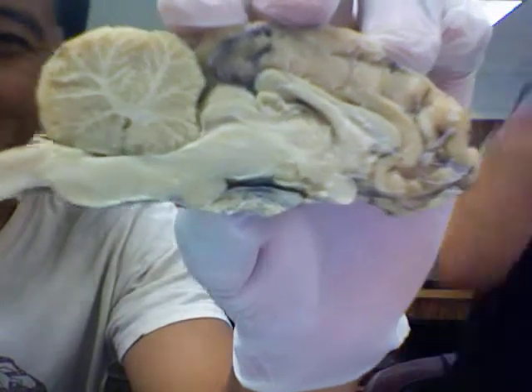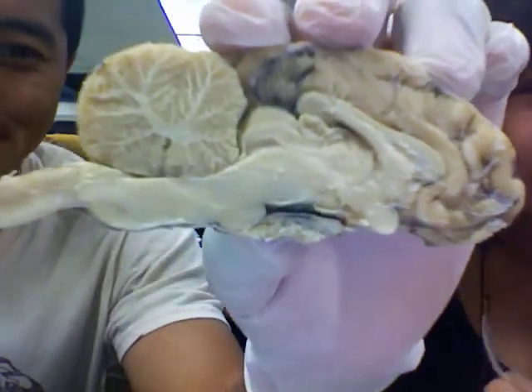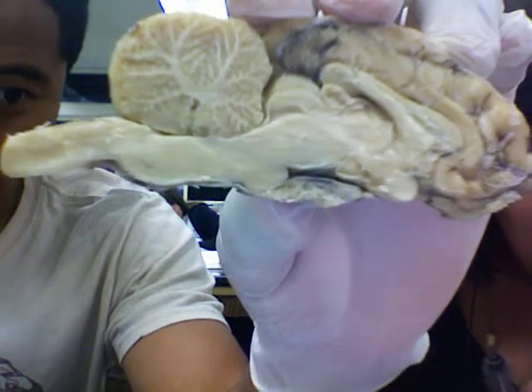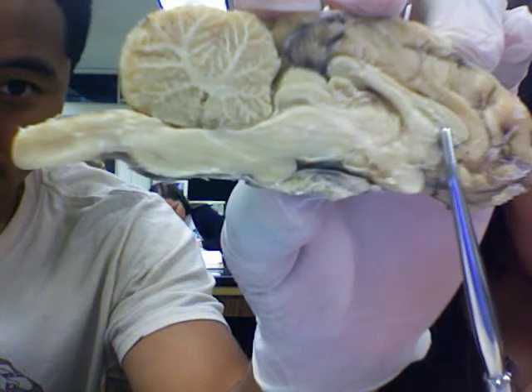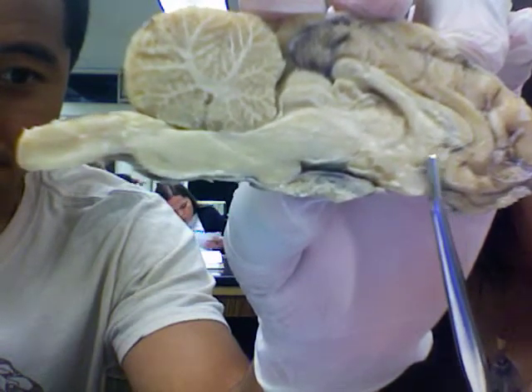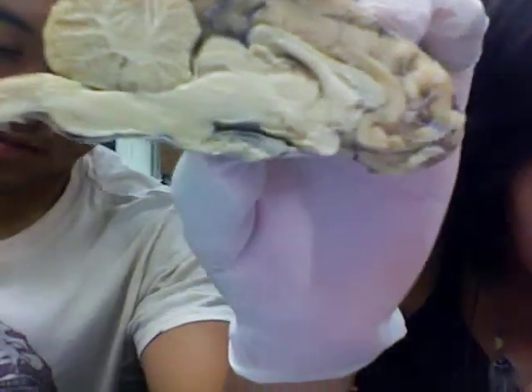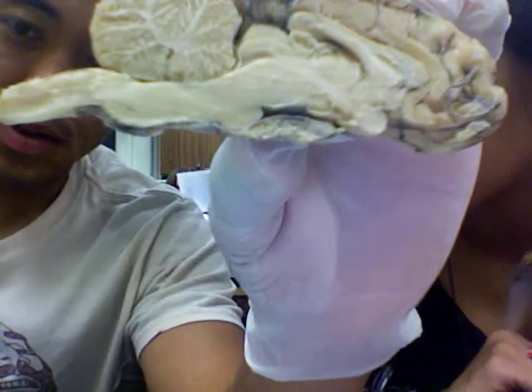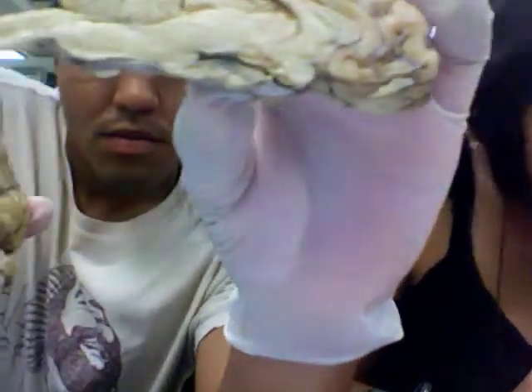Sorry, you're doing so good. All right, so the lateral ventricle is like somewhere around here — it's cut, right? Yeah. And then the olfactory bulb is right here, or it would be right there. Yeah, you can show that brain.